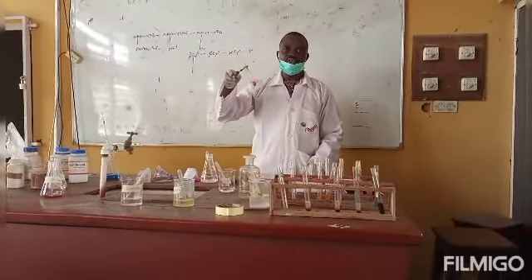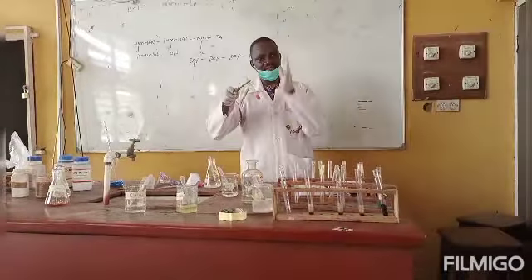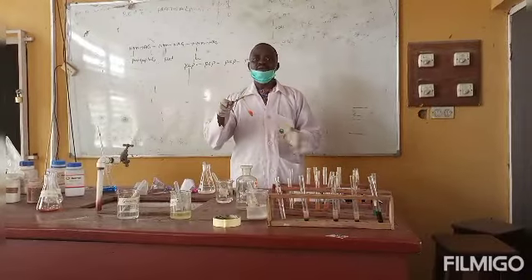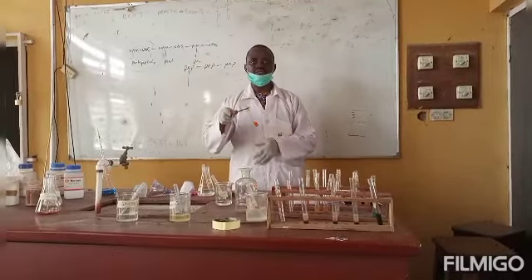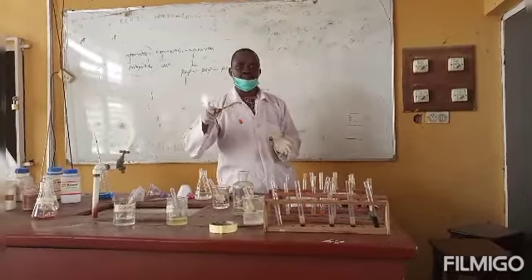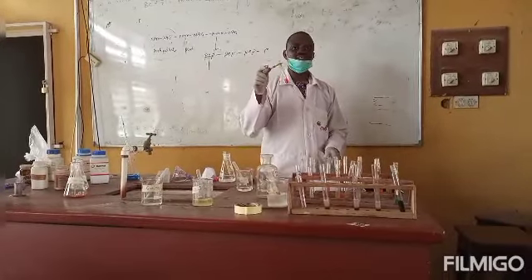Orange coloration. That tells us that the concentrated HCl and the heat applied on the sucrose have been able to break the glycosidic linkage that joins the glucose monomer to the fructose monomer, leaving glucose as a separate entity and fructose as a separate entity. As a matter of fact, the reducing end of the glucose is now free for reaction, while that of fructose is also free for reaction. That is why we have this positive test.